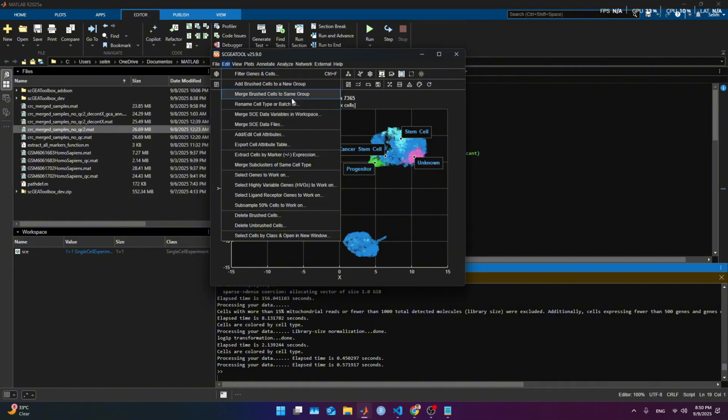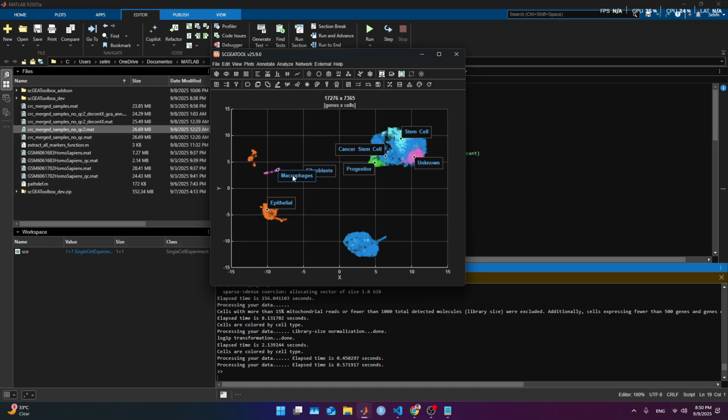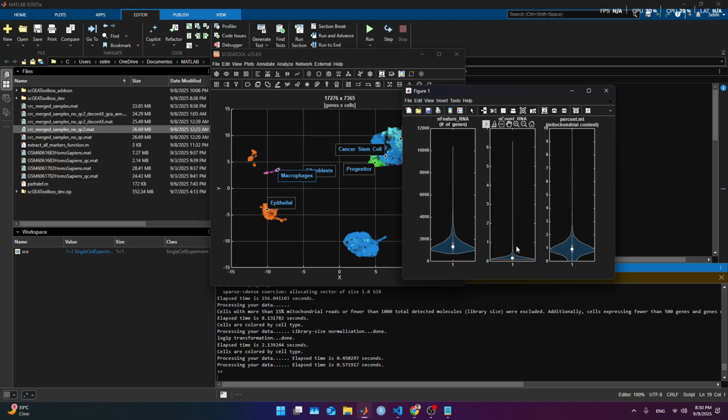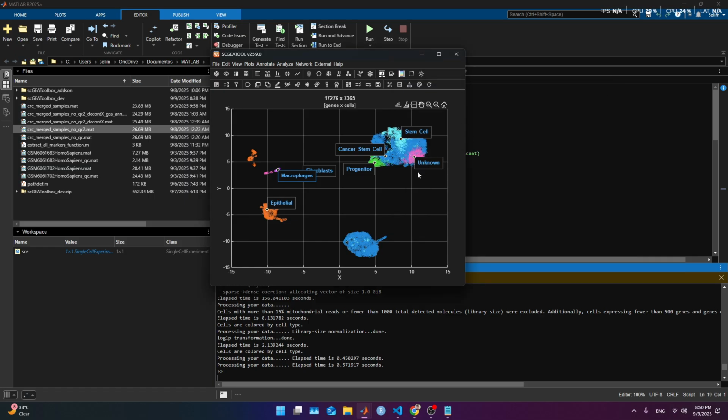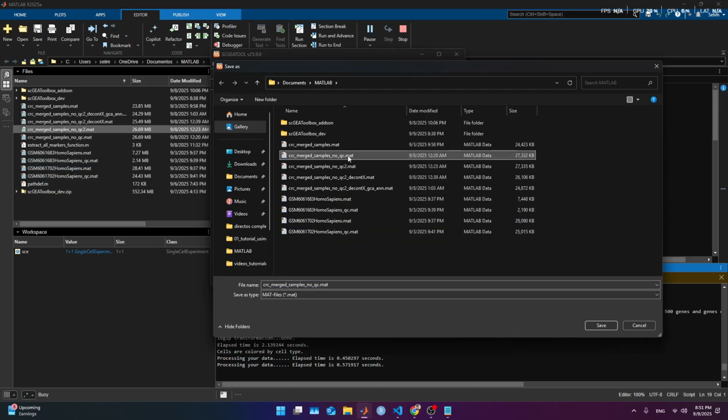So what we gotta do is just again look at the violin plots. Where is that? Violin plots of QC metrics. And after it pops up, we can see that the expression library size is very small. Mitochondrial is small, which is fine. And the number of genes is 400 approximately. So it seems that it is quite low quality. So I'm gonna save it just to keep track of it. I'm gonna call it NoQC custom annotated.